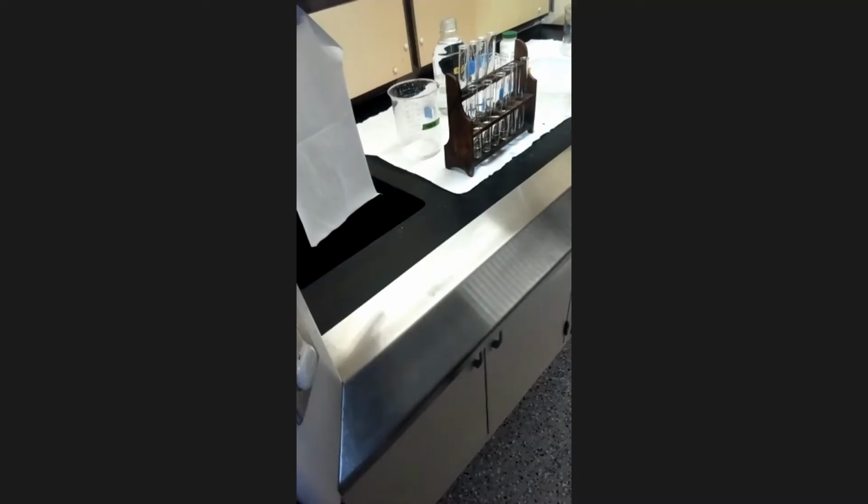Great. At this point, I have put the buffer into each of the tubes that I need, and I will now move those tubes back to my station and bring you over there to show you the next step.